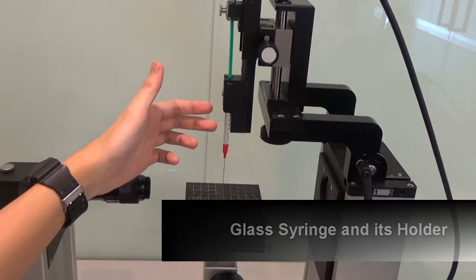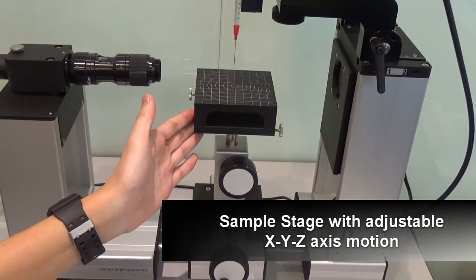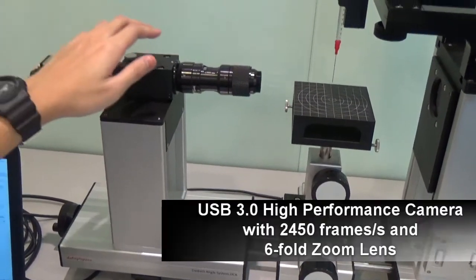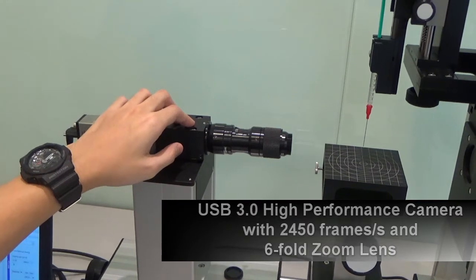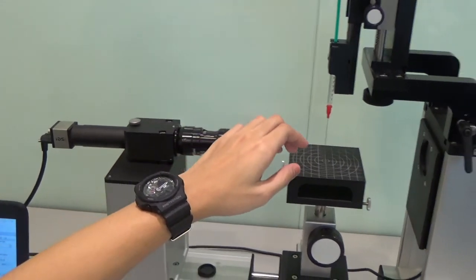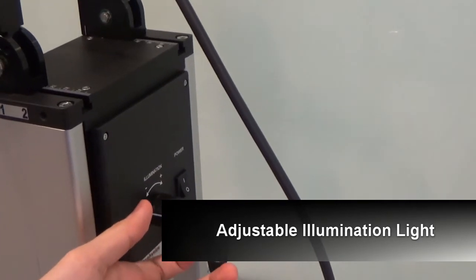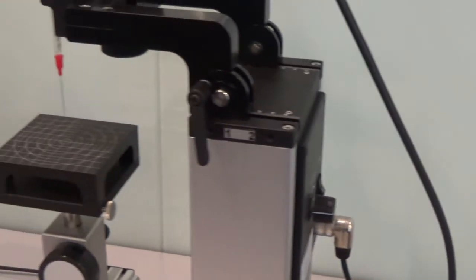Next we have the glass syringe where you can put your solution in. Then there is the sample stage with adjustable XYZ axis through these three knobs and spindles. Next is the main optical camera system to capture video and images, which comes with magnification and focus controls. Lastly, the illumination is adjustable through a knob to control the brightness of the light.